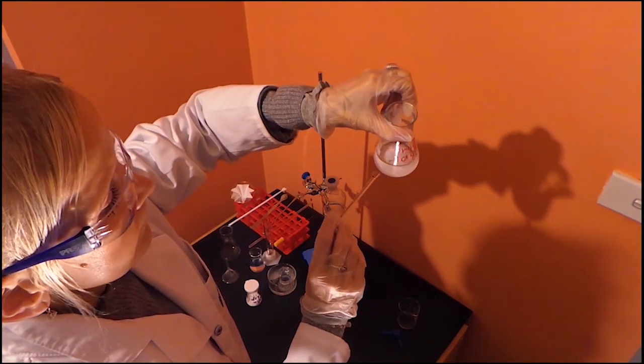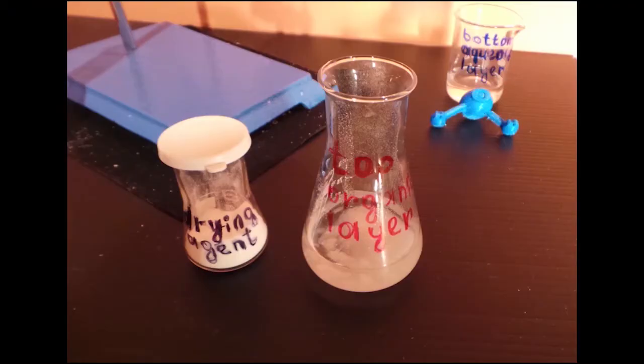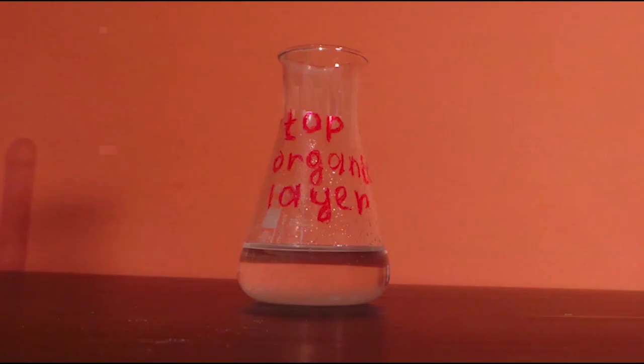We want to let it set for 10 minutes to make sure that all the water is absorbed out of the organic layer. The solution will become clear when it is dry.